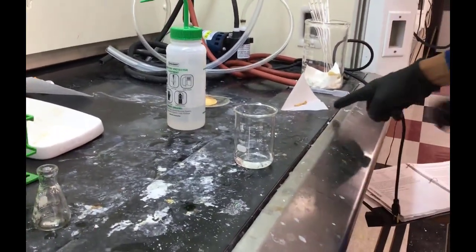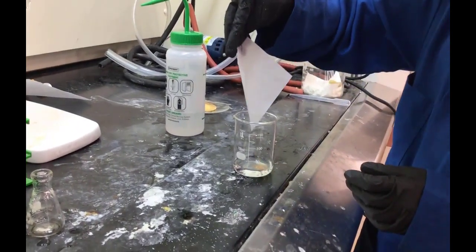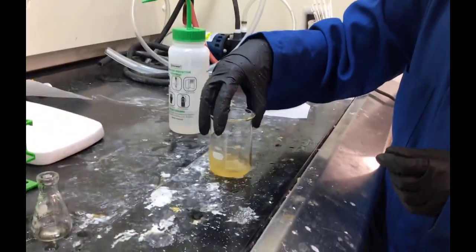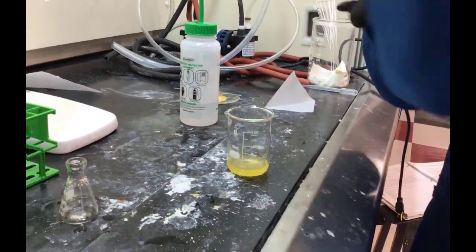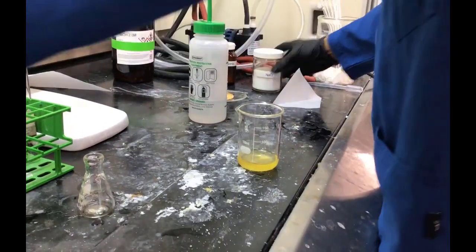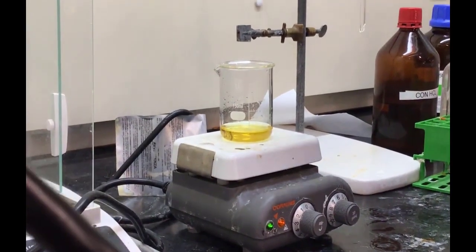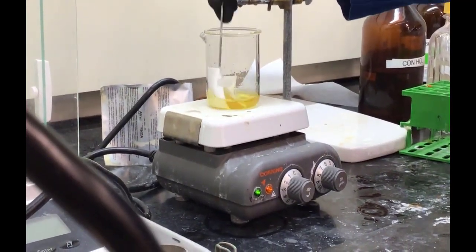All right, there's the water, adding the 50 milligrams of azo compound, our C3. All right, they're gonna shake it up to try and help dissolve it, but then they're also going to put it on the hot plate, heat it up a little bit to increase the solubility. All right, so it's been heated to where it's all dissolved, so we saw a clear, translucent solution.